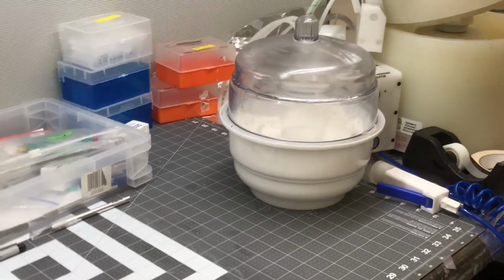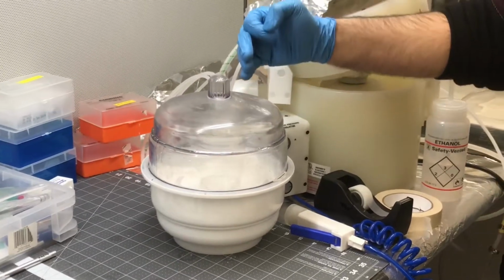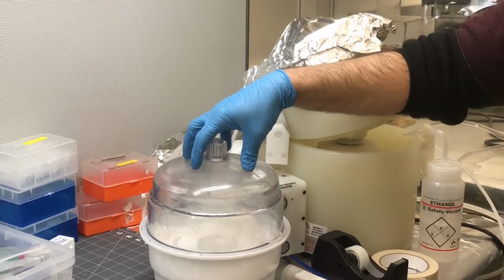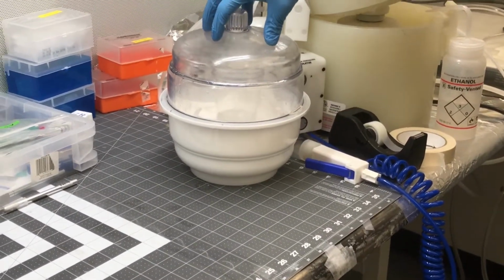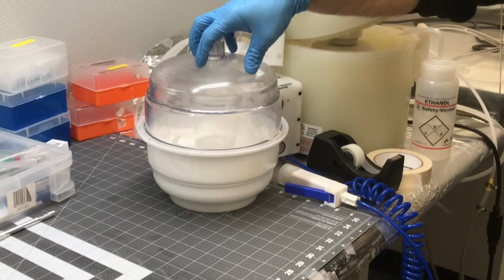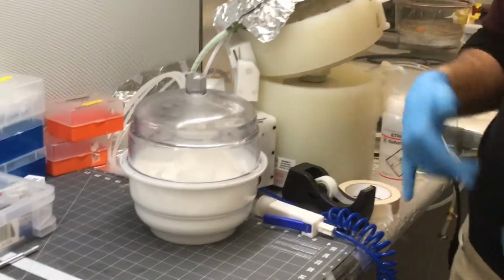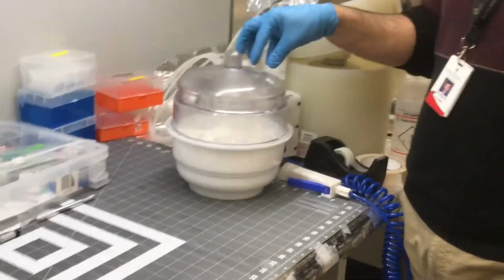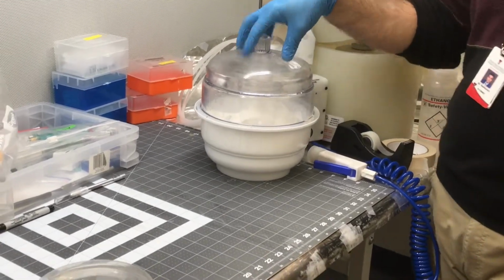But the point is, again, I will emphasize this point: they should not keep PDMS with curing agent too long in the vacuum. As soon as the bubbles are gone, that's the reason nobody should leave it and go and then come back. This is totally wrong. Whenever it's bubble free, you have to immediately pour it onto the master mold.